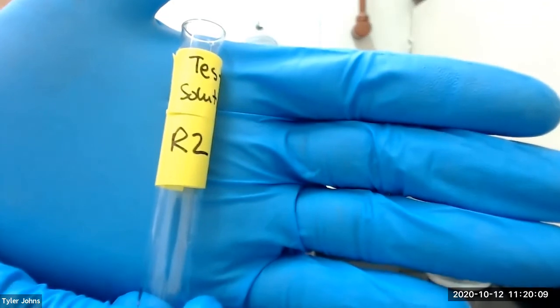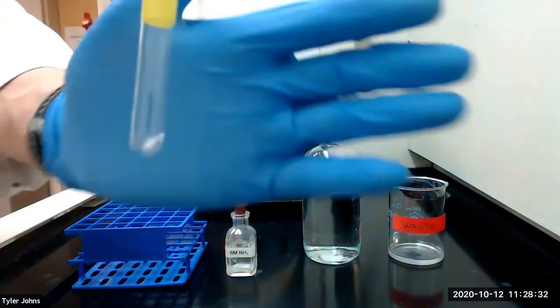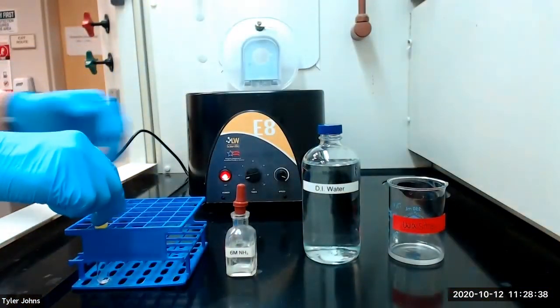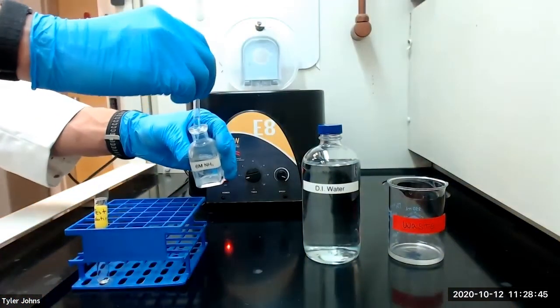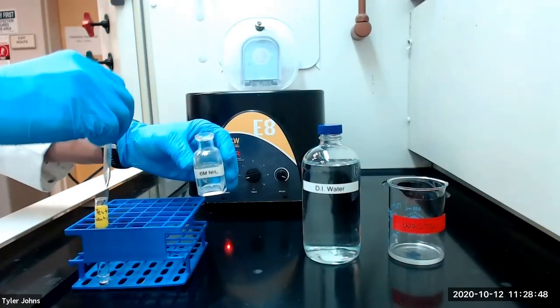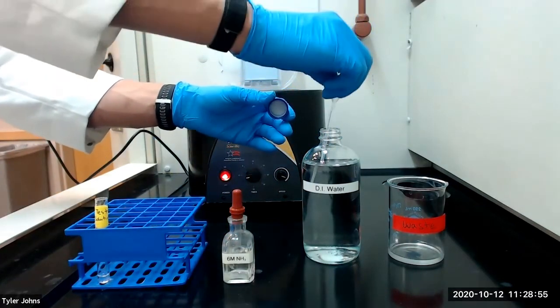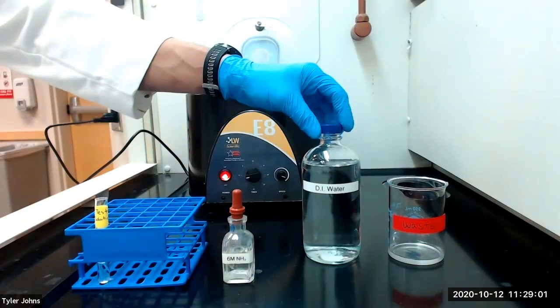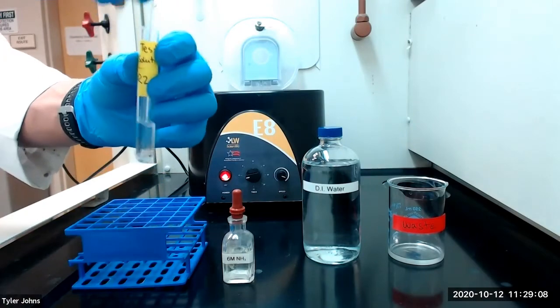Our residue R2 is now ready to test for the presence of silver ion. We will now test for the presence of silver ion. To our residue R2, we will add 1 milliliter of 6-molar ammonia. We will also add 2 milliliters of deionized water. We will stir and then centrifuge.